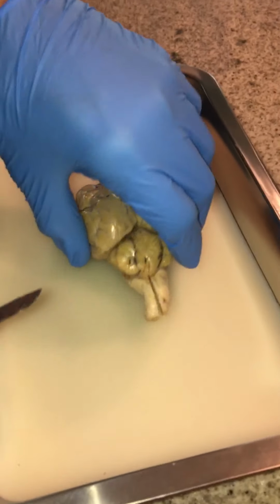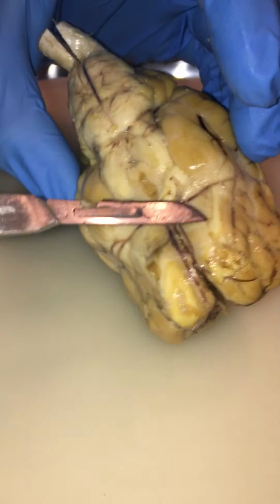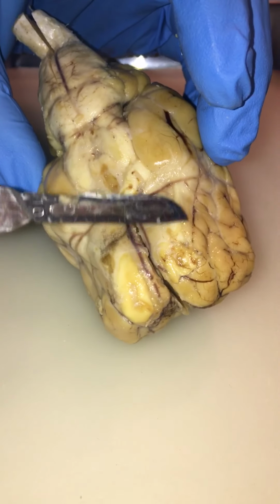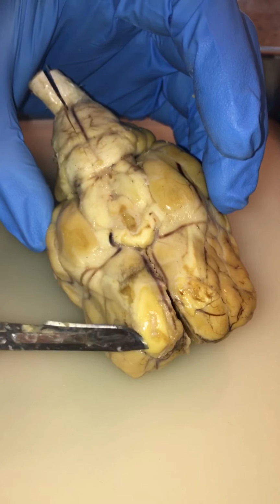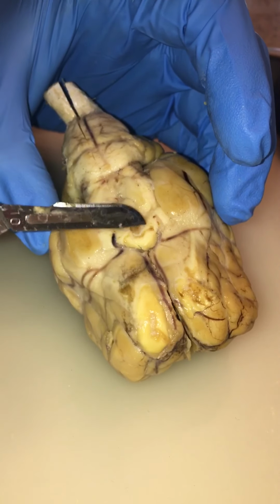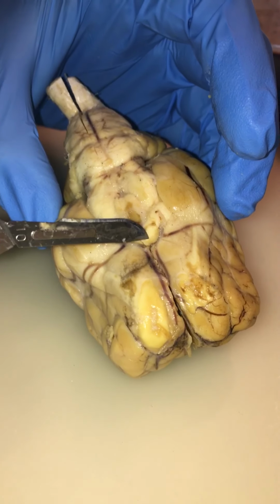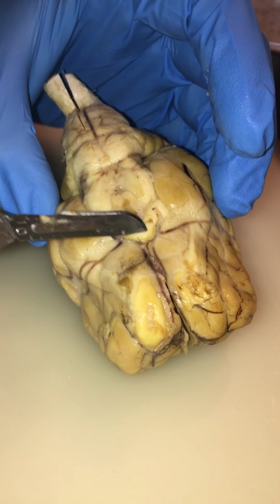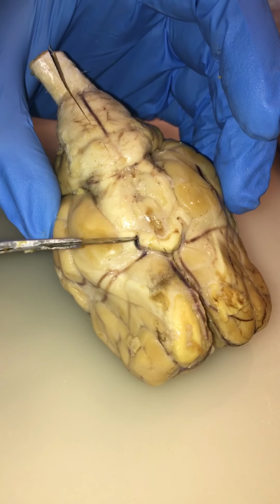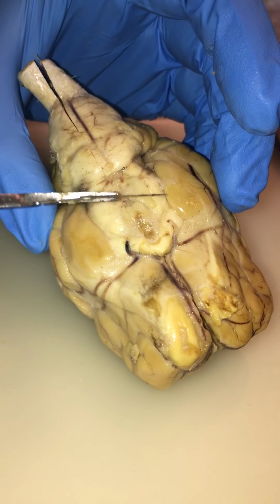Now we'll get into the nerves. So here you have the olfactory nerves, which is housed in the olfactory bulbs, which is where we get our sense of smell. You then have the optic nerves, the optic chiasm, which is kind of what connects the two optic nerves, and then the optic tracts, which run down here. The chiasm being this middle meaty part there of the optic part.